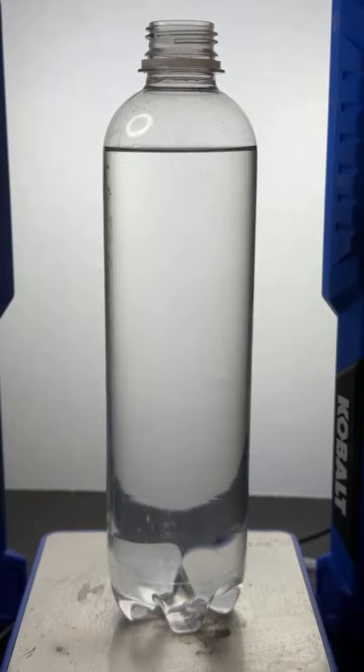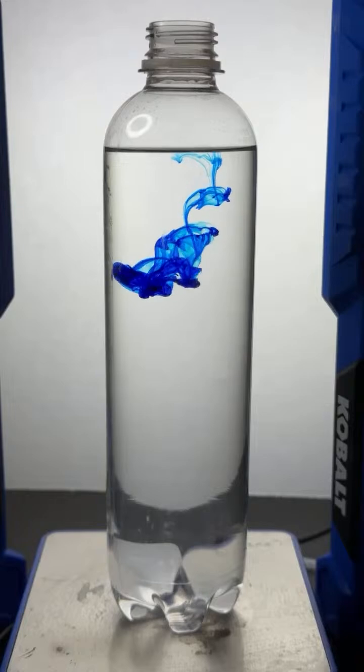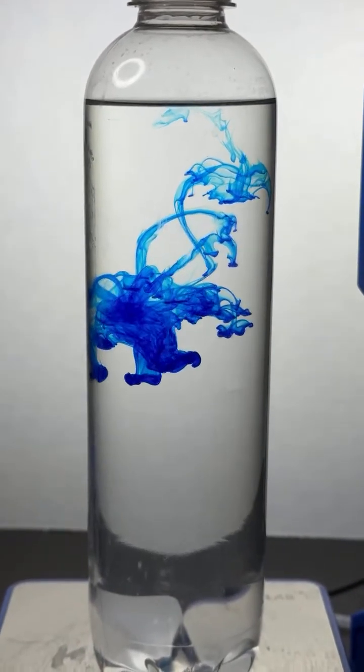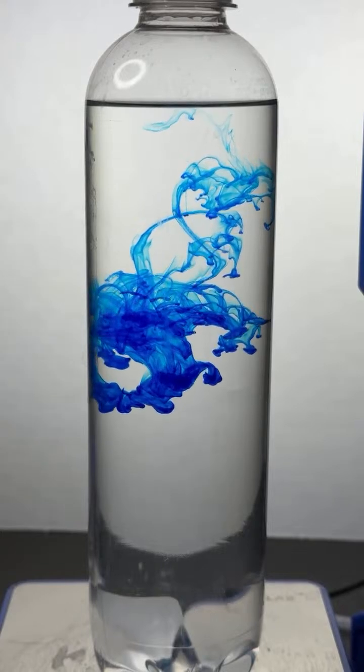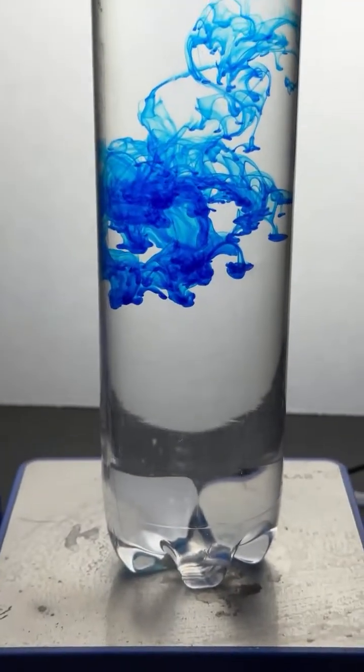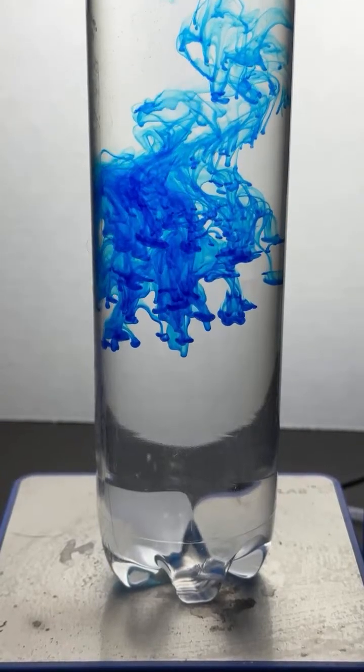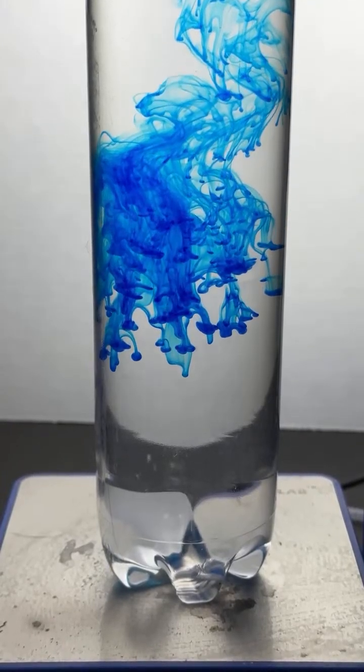Okay, here we go. We're going to add a drop of blue food coloring to this liquid. In goes one drop. I just think that's gorgeous, the way the liquid moves. Hey, we got someone from Utah coming in. Great to hear. Look at how gorgeous that looks, huh? Even just a drop of blue food dye in this particular liquid is absolutely gorgeous.